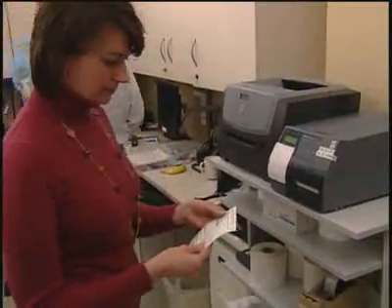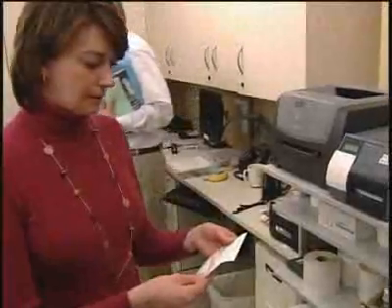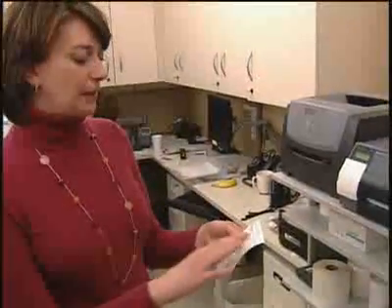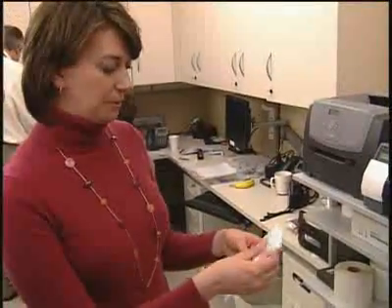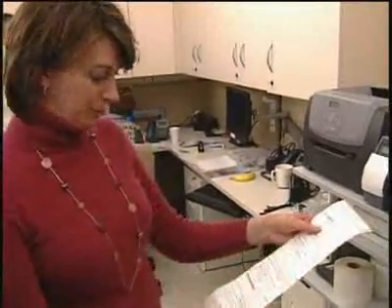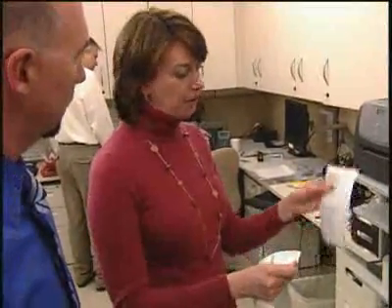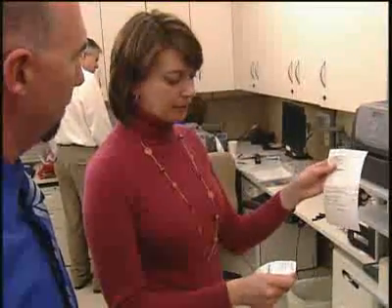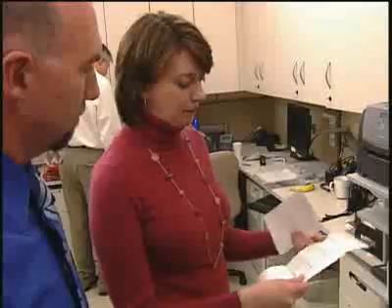Okay, once you have the label, what is our next step? Then I make sure that everything I wanted to print actually printed and then I'll take it back to the technician and they will prepare both — they'll prepare the pre-med first and then the chemotherapy.